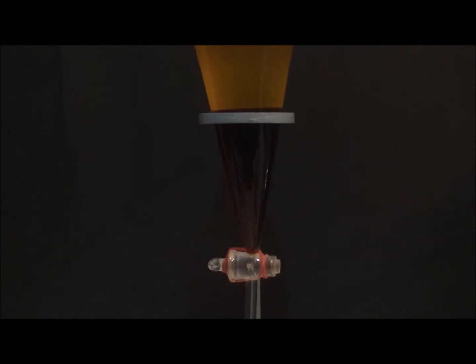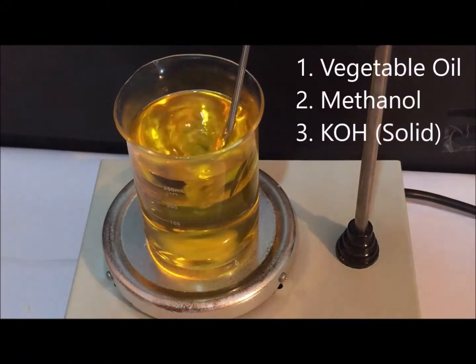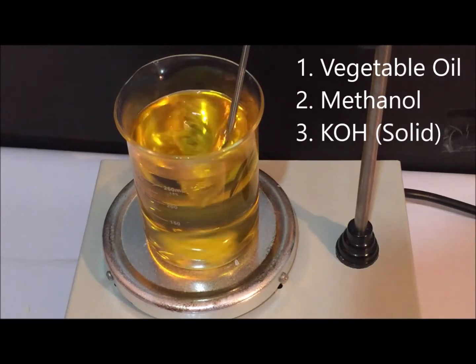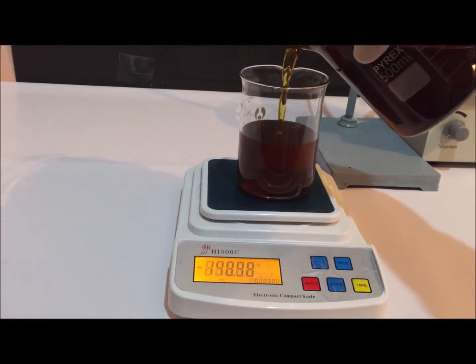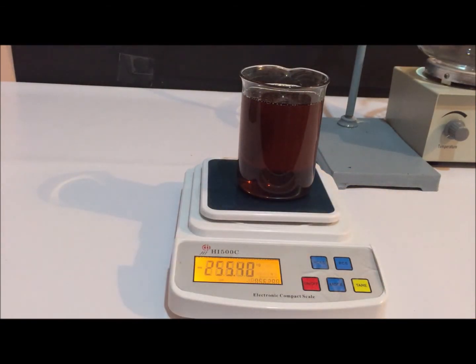Here, biodiesel is produced by the transesterification of vegetable oil. For this reaction, the chemicals required are any generic vegetable oil, methanol, and potassium hydroxide. We start out by weighing a sample of our vegetable oil. My sample weighed around 255 grams. This weight was used for computing the mass of methanol and catalyst required for the reaction.